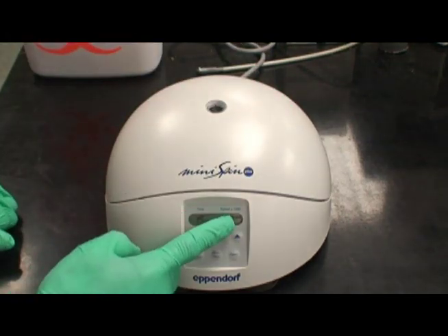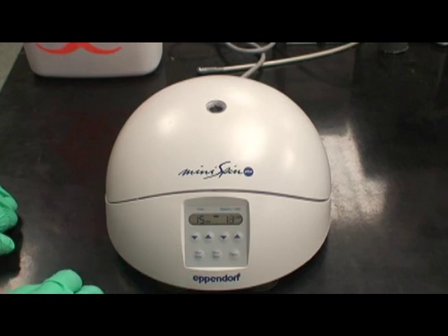After selecting appropriate time and speed, you may start the device. The device will stop on its own at the end of the cycle.